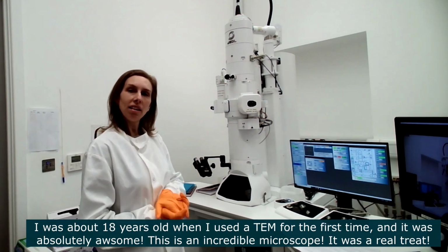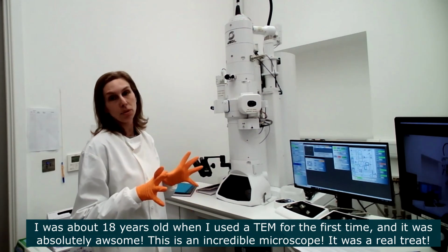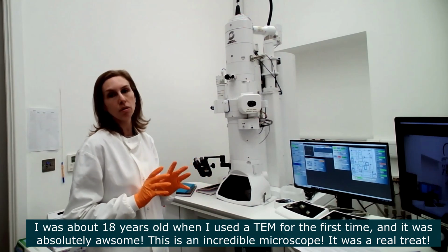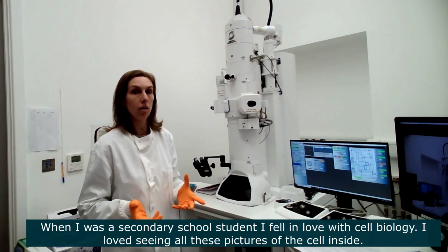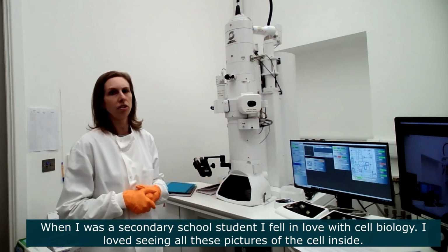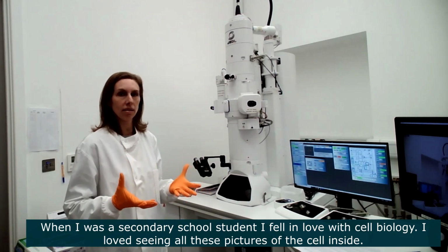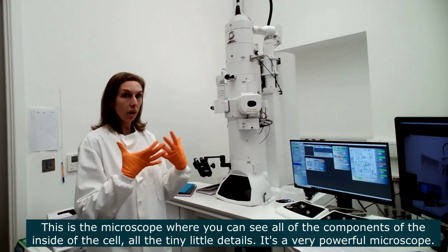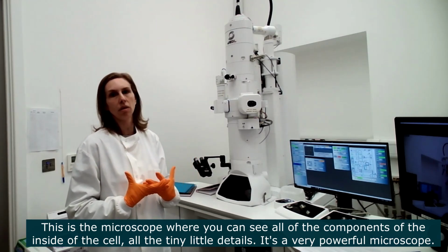I was about 18 years old when I used this microscope for the first time, and it was absolutely awesome. This is an incredible microscope. It was a real treat. When I was a secondary school student, I really fell in love with cell biology. I loved seeing all these pictures of the inside of the cell. This is the microscope where you can see all of the components of the cell and all of the tiny little details of these things.